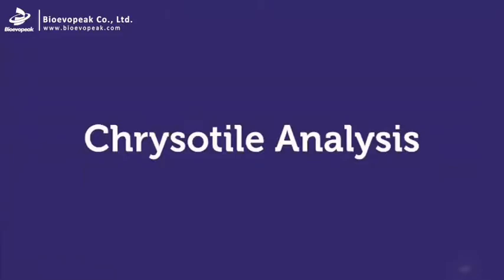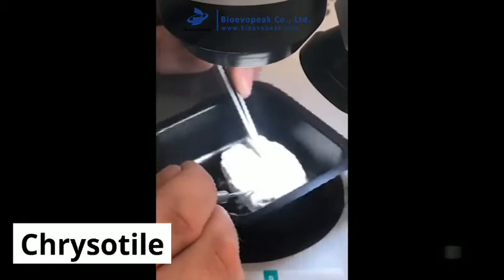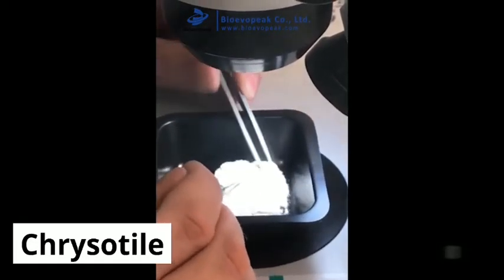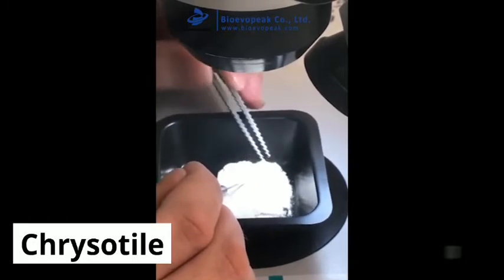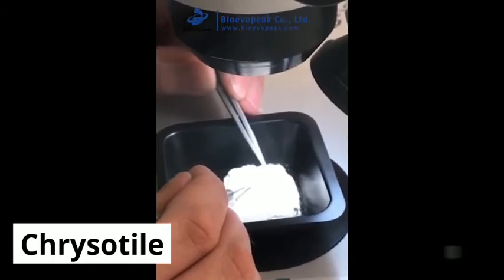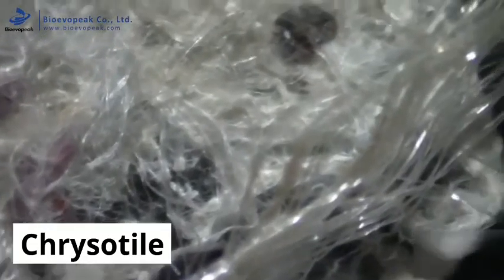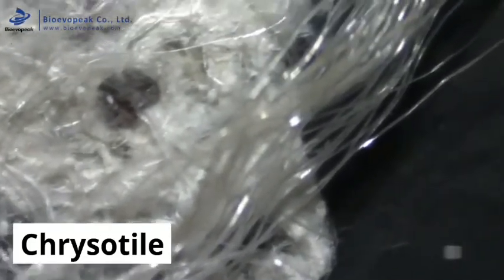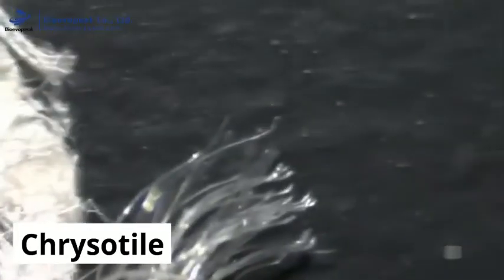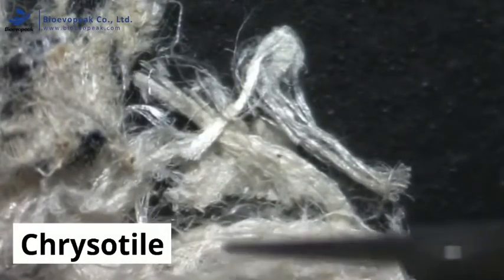Also within insulating board, you can often identify chrysotile, or white asbestos, mixed in with the amosite. So the analyst goes back to work manipulating the sample in search of these fibres. Chrysotile is a serpentine form of asbestos, which results in a much more flexible and curly-looking fibre than amosite. The analyst finds suspect chrysotile fibres and separates them from the sample once more.